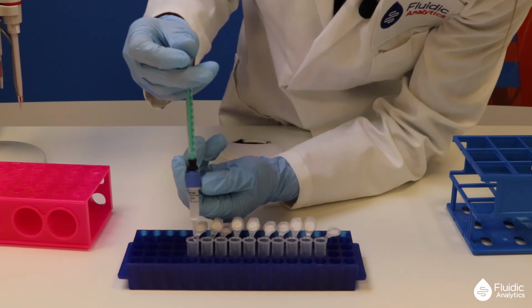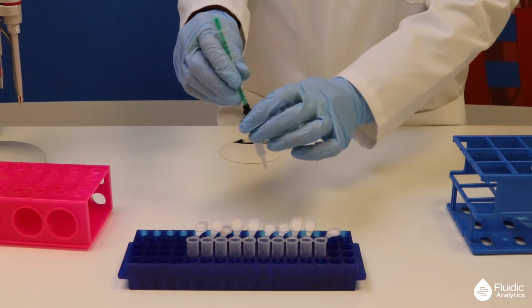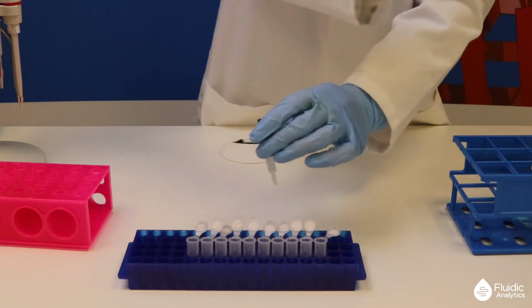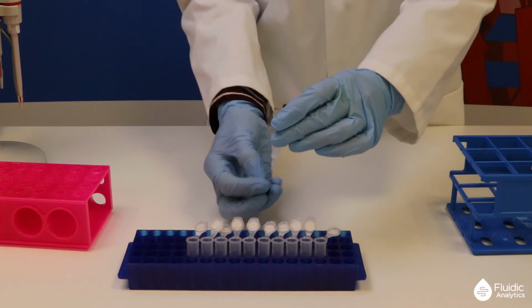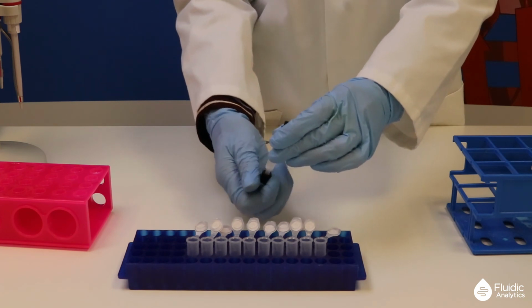When the 1 ml is consumed, the syringe can be disposed of. Cap the cartridge to prevent it drying out while you characterize your purified protein. The column can be reused for more of the same protein by washing with 5 ml of water or buffer before loading the next sample.